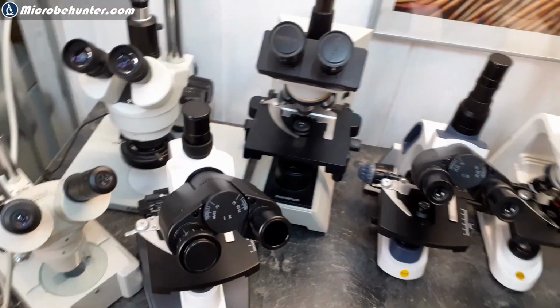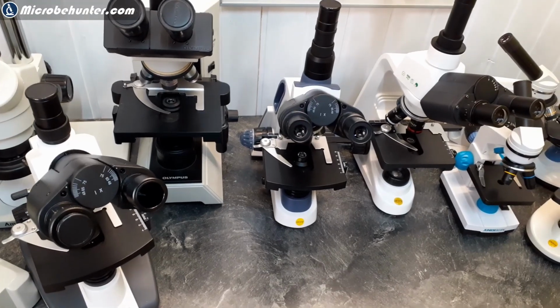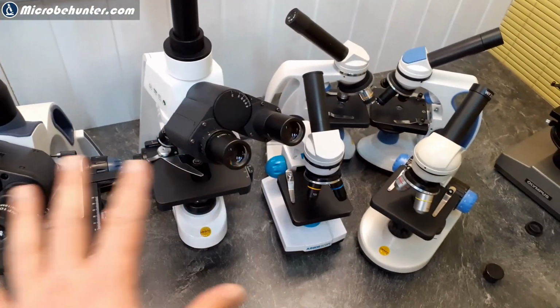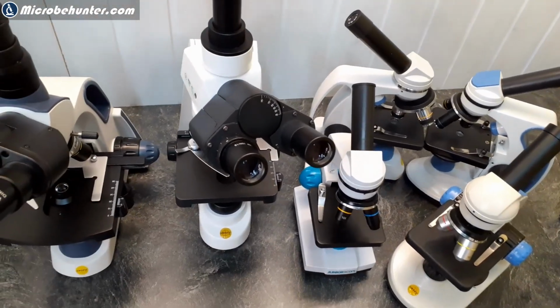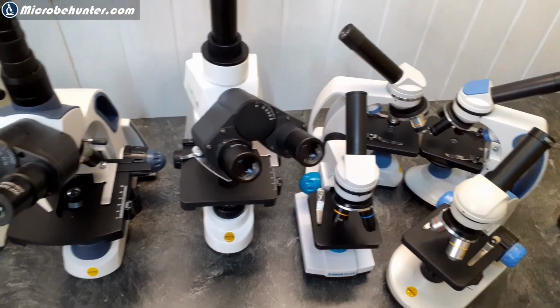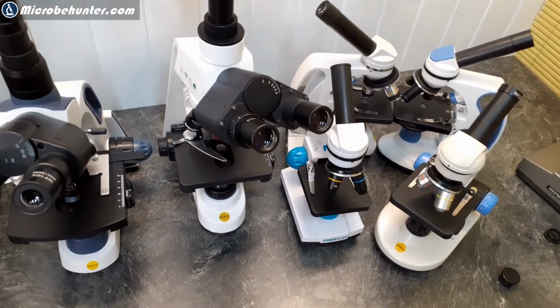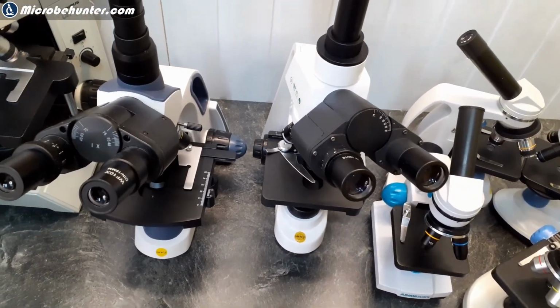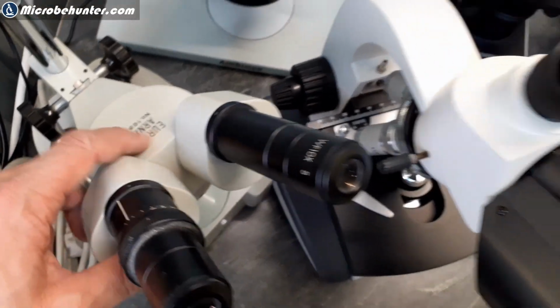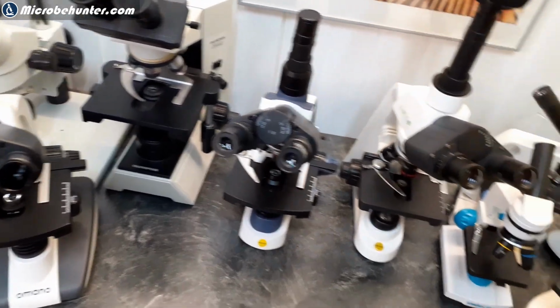What I did not talk about is real research microscopes. What's a real research microscope? Well, those microscopes here are all manufactured in China and then rebranded, but there are some brand microscopes from the big 4 microscope manufacturers, and they have an entirely different target group. Olympus, Zeiss, Nikon, Leica, in no specific order. And there are also some other companies like Euromex. This one, for example, is a Euromex microscope, which also offers very high quality microscopes, also for amateurs.